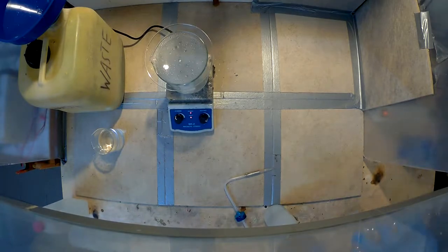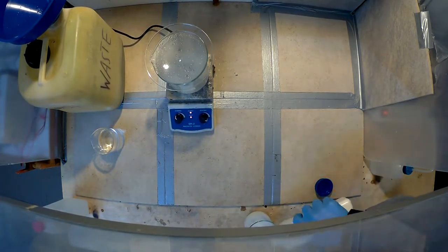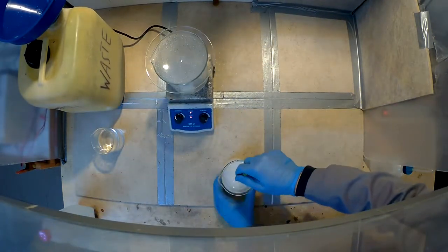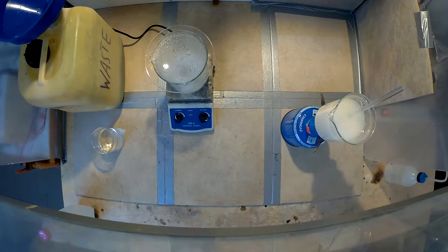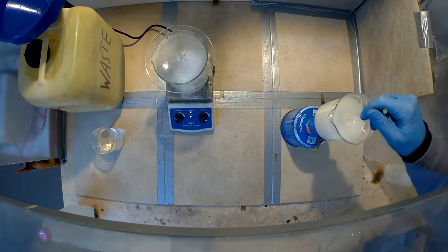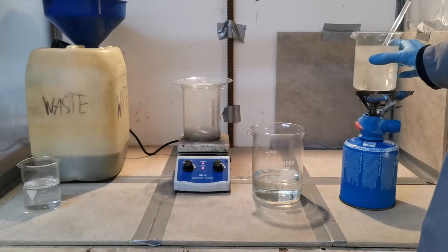If you want to use stoichiometric amounts, it would only need around 100 ml of 32% acid to dissolve it. But I added at least 300. I even poured the solution off into another container before dissolving the last bits with some fresh concentrated acid. While I was doing that I also prepared a solution of sodium carbonate. I added way too much and barely got it to dissolve with lots of heating.